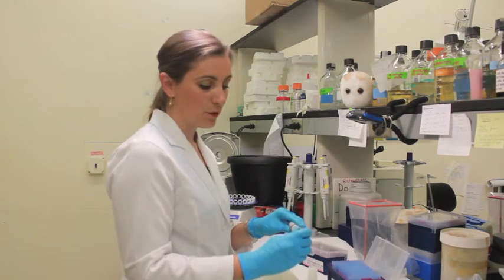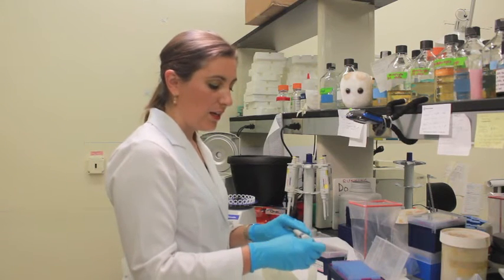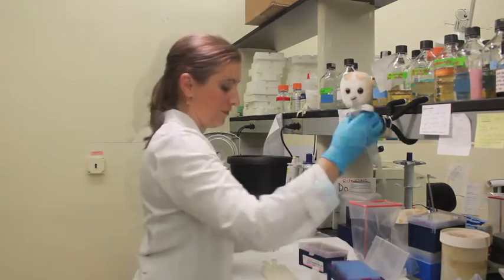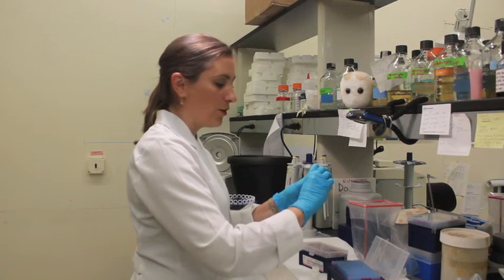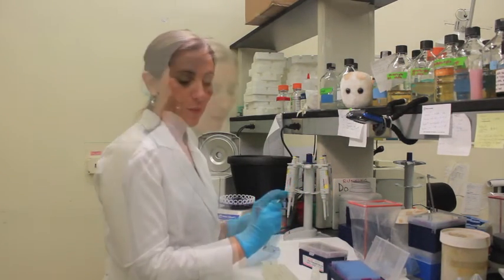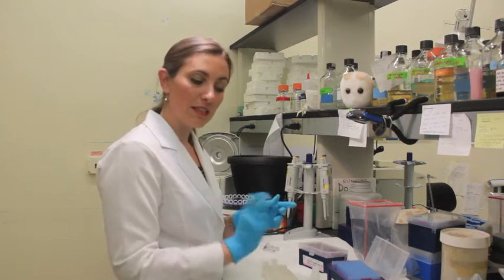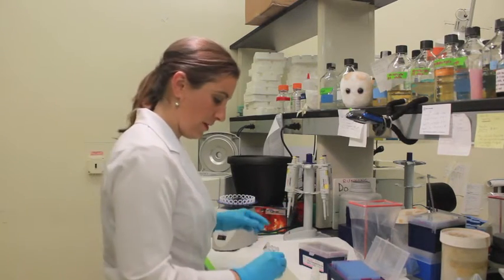To make this as few steps as possible, set your pipette to 600 microliters and transfer two volumes into your sample tube. The volume may look like it doesn't fit, but if you close that lid very carefully, you'll see it's perfect for this tube. Once C4 is completely added, gently mix it up. The next step is moving to another special tube for the MoBio kit — we are now at the spin column filter.